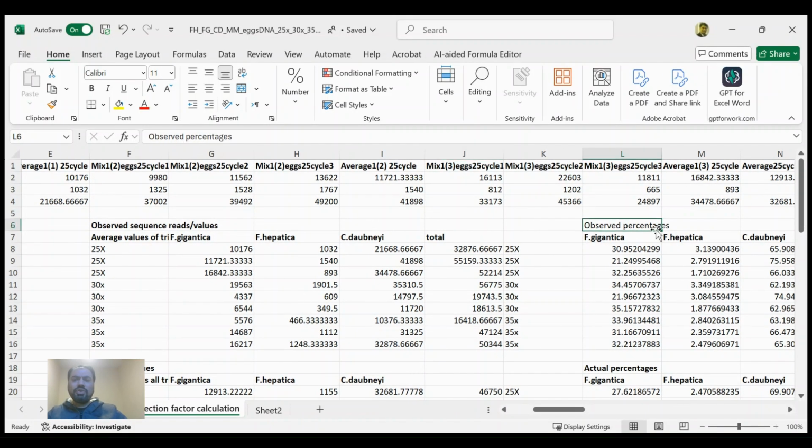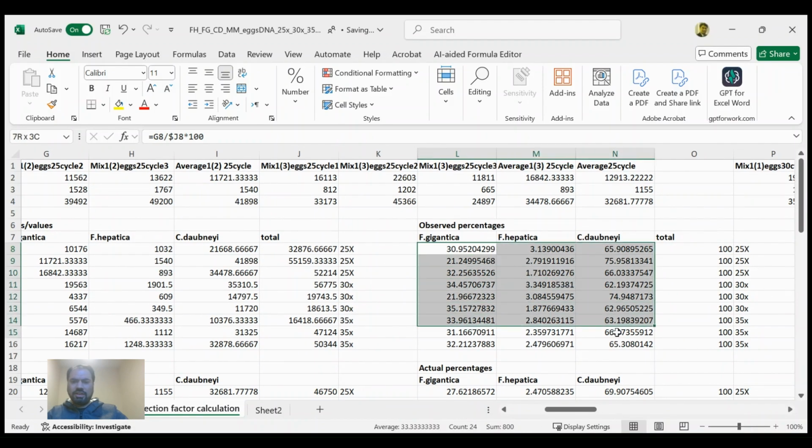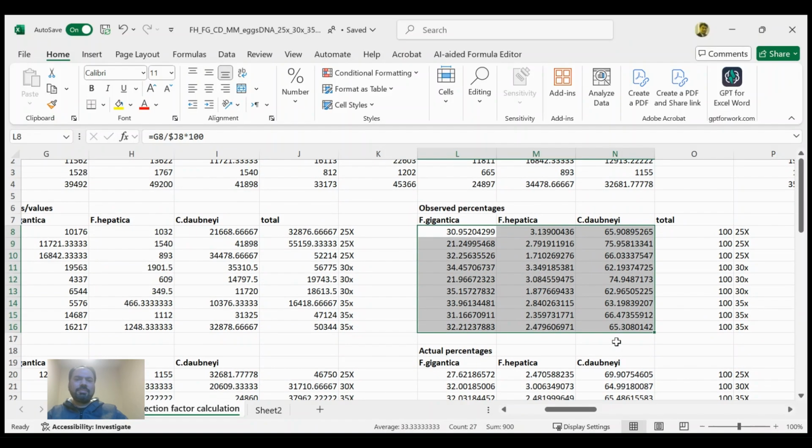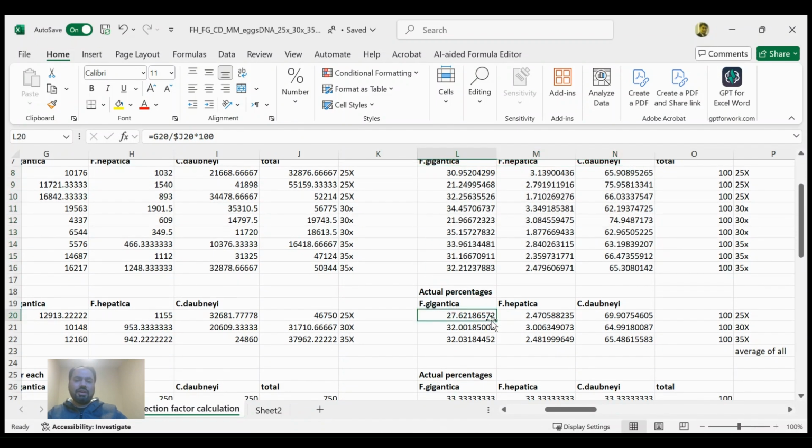Then the further step is to calculate the percentages of the observed reads. Here you can see, using the formula shown over here, that we have just divided, for example, the number of reads observed for Fasciola gigantica by the total number of reads, and likewise for all the others. So here you can see that all average percentages are calculated for the actual observed sequence reads, and similarly the percentages calculated from the averages of all.